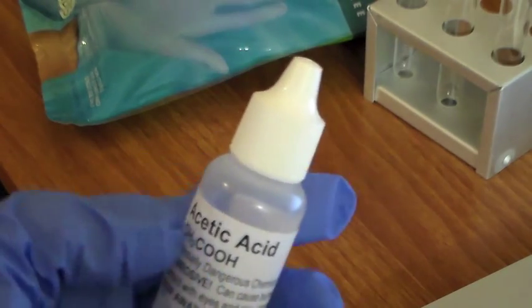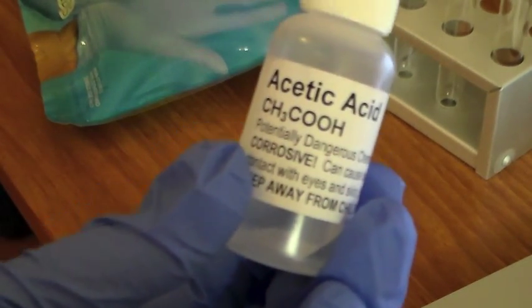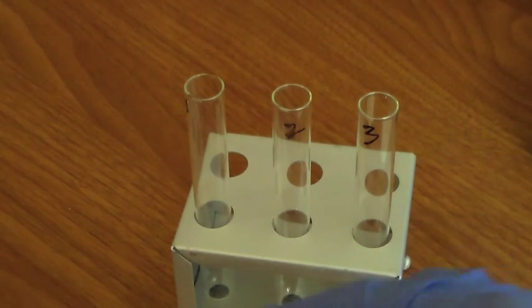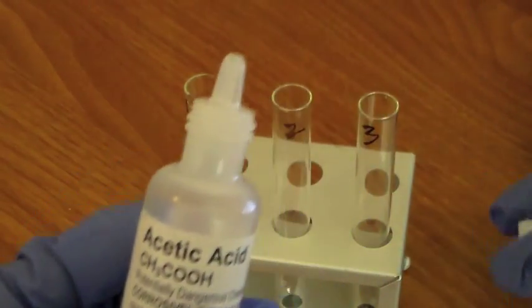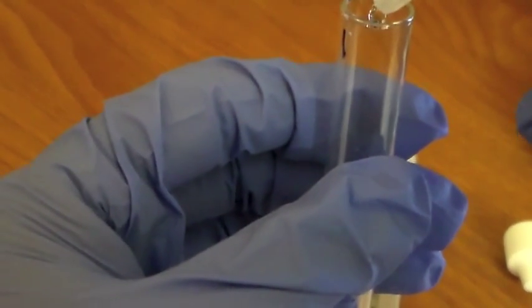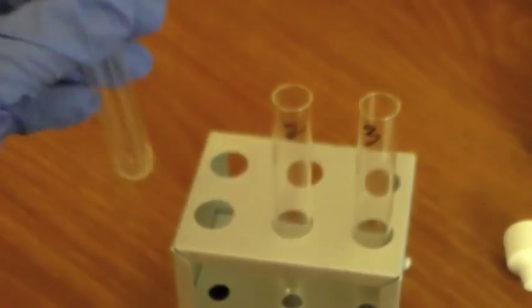Okay, so we're going to have this nice little bottle of acetic acid. I'm going to put 4 drops in each of these test tubes: 4 drops in test tube 1, 4 drops in test tube 2, 4 drops in test tube 3. Acetic acid. So here we go. 1 drop, 2 drop, 3 drop, 4 drops.